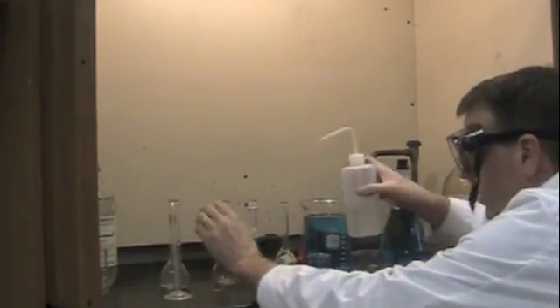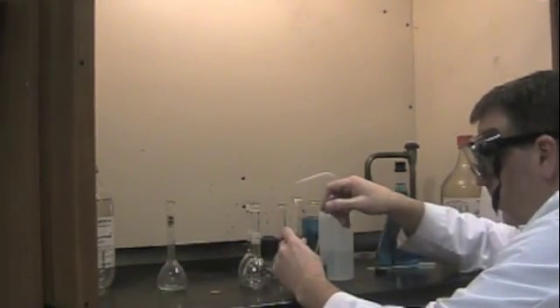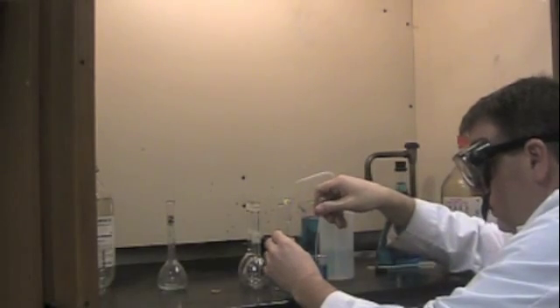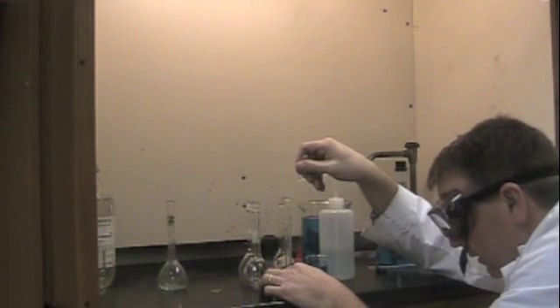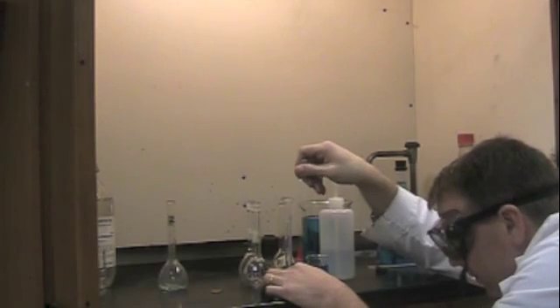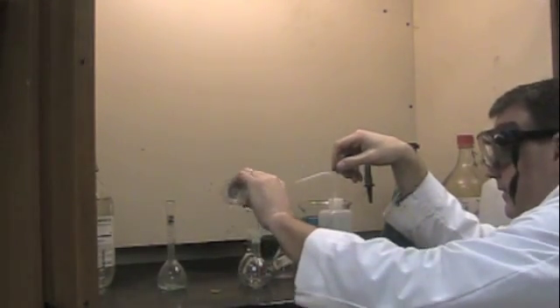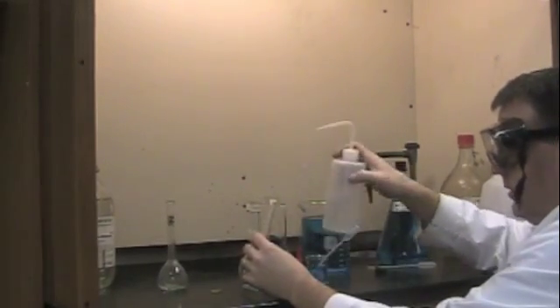In the one labeled 4, you would want to put 4 milliliters of the standard solution. So once again, measure very carefully. There's 4. And then rinse again.